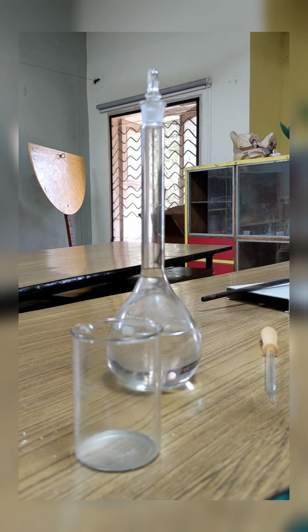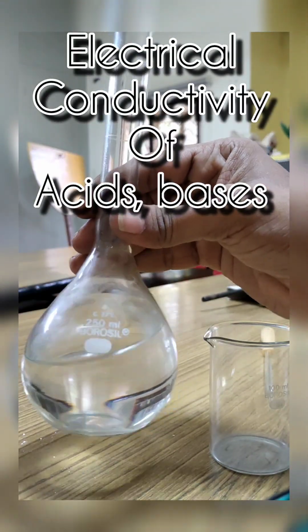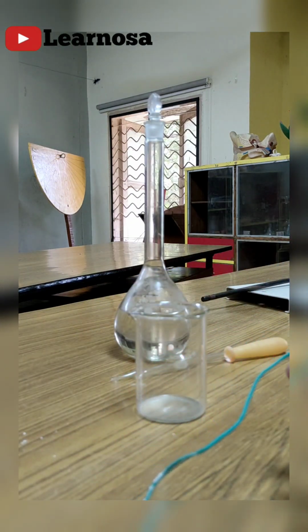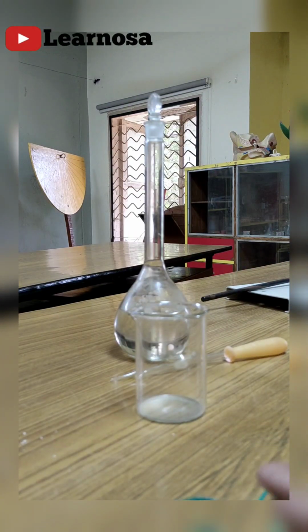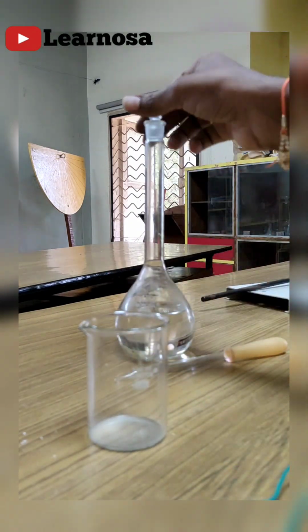Dear students, today we will see the electrical conductivity of acids. Here I have already prepared hydrochloric acid. This is a dropper and the beaker. Now I have set up the electrical conductivity circuit here. Normally it consists of a bulb and a battery. Now we'll see what happens when electricity passes through acids.